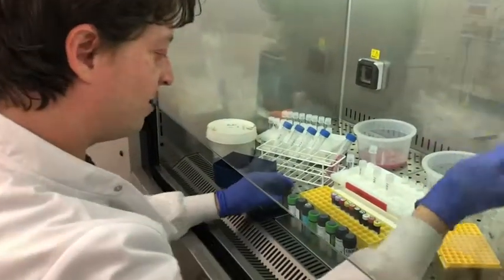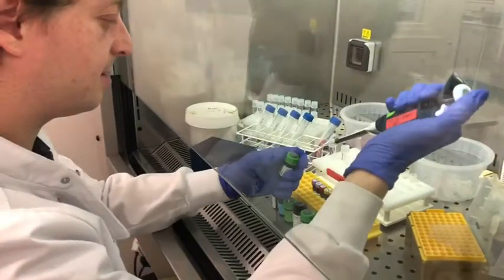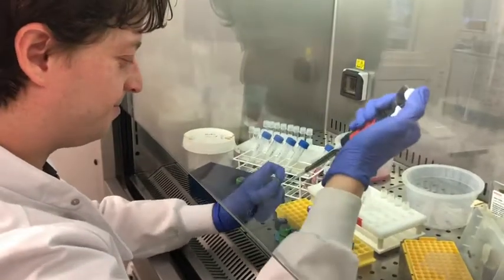So I'm just going to make up a master mix with all of the different antibodies added. Just going through in turn.